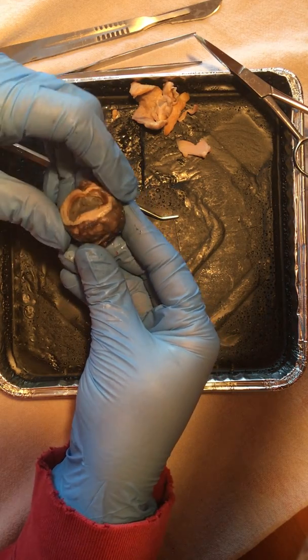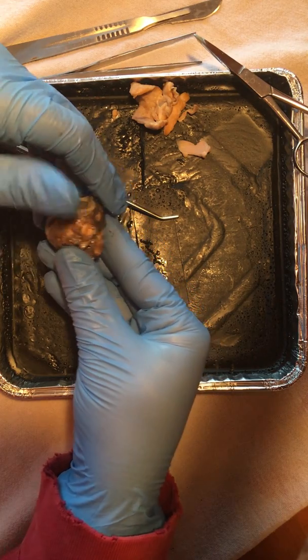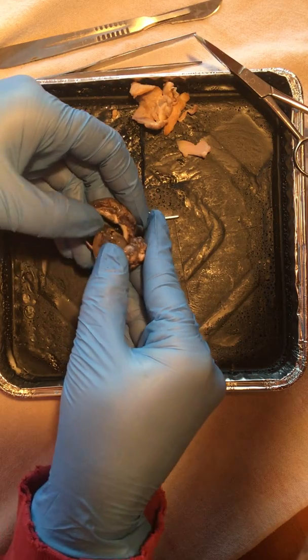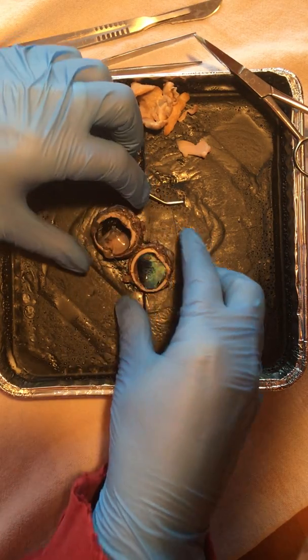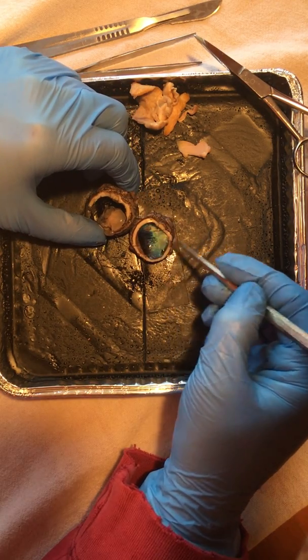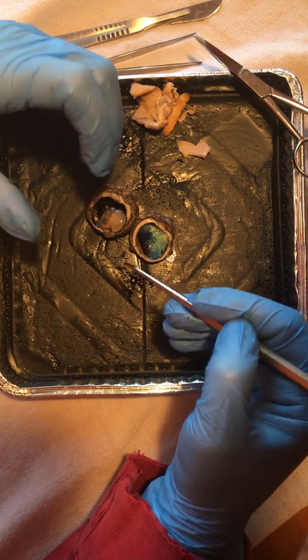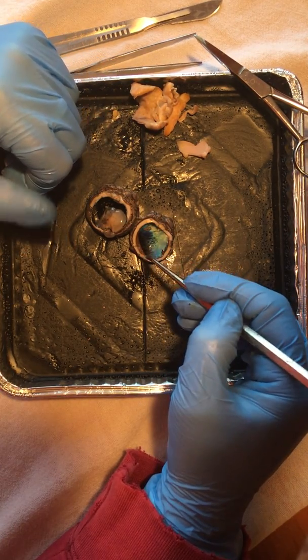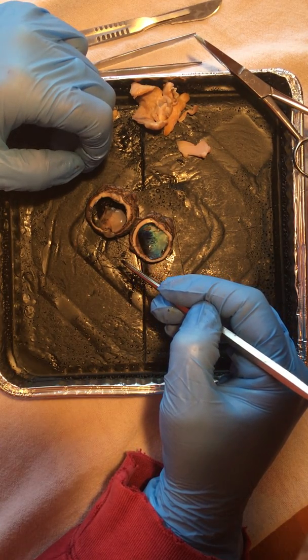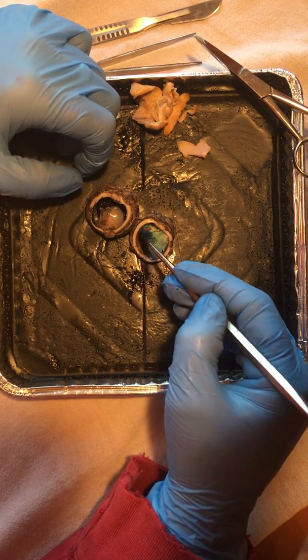So we've made a cut along the coronal plane, which separates both the anterior and the posterior portion of the eye, and when we open up those two hemispheres, right off the bat we'll notice that sclera, that white portion of the eye. The sclera is what's responsible for that durability. It's that connective tissue that protects a lot of these inner structures. It helps maintain a lot of rigidity, and it really keeps things protected in there.